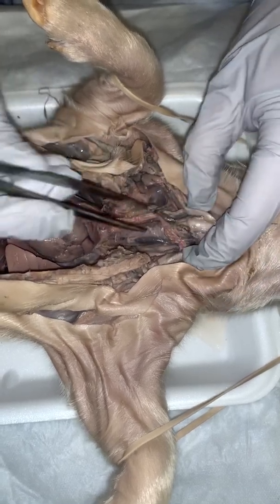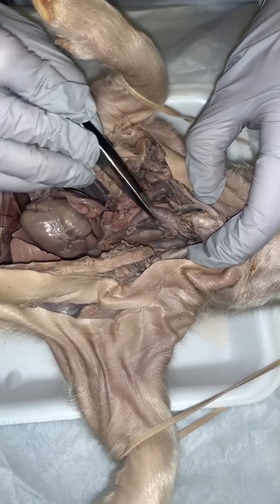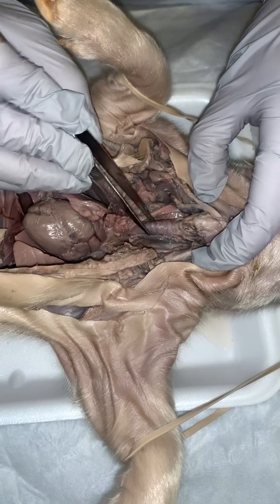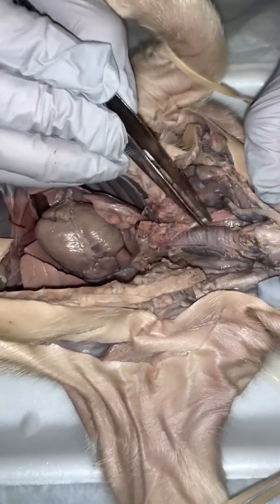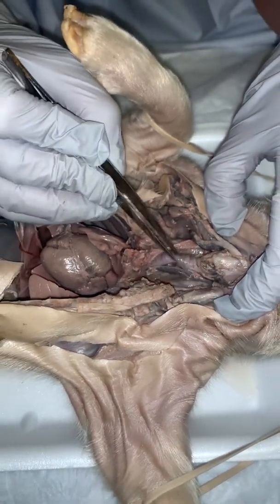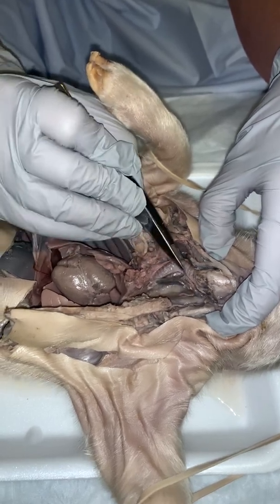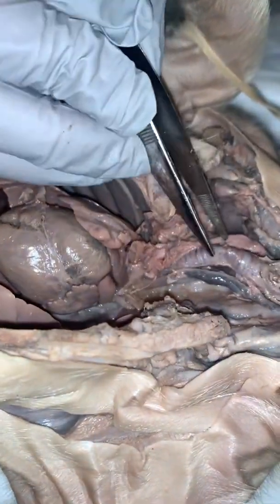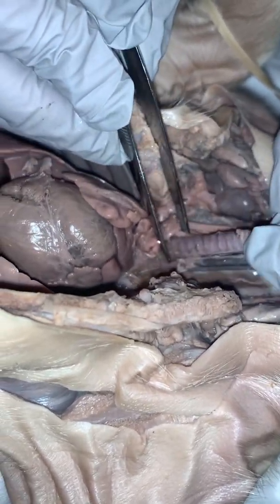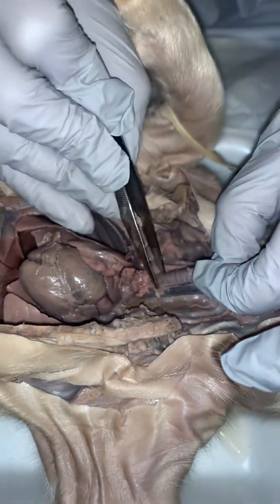Okay, from the larynx, we're going to move into the trachea. Right here, trachea. This is also known as the windpipe. And the trachea is made up of 16 to 20 C-shaped cartilage rings right here. And you can kind of see those little coiled looking ring structures. That's the windpipe. 16 to 20 C-shaped rings.